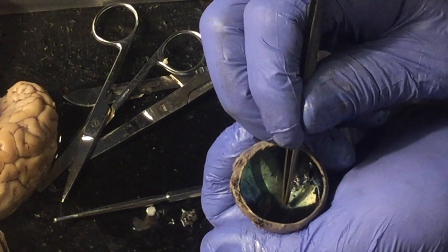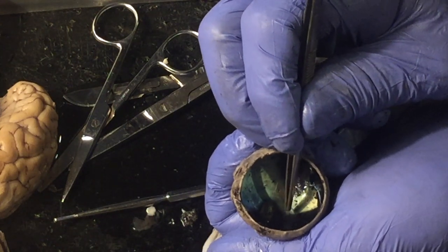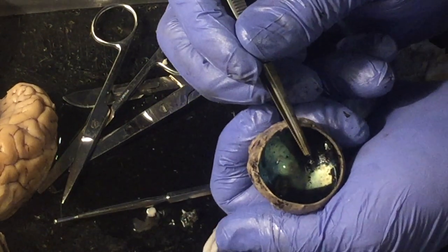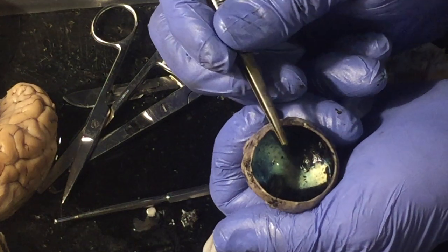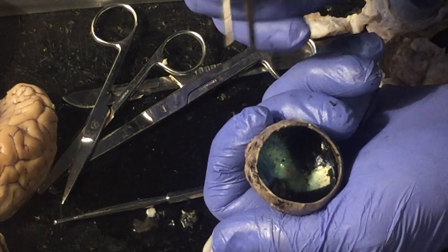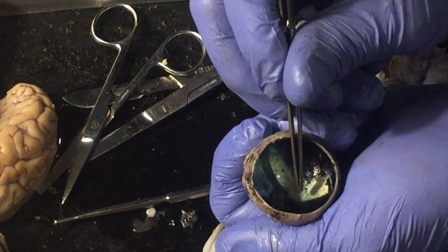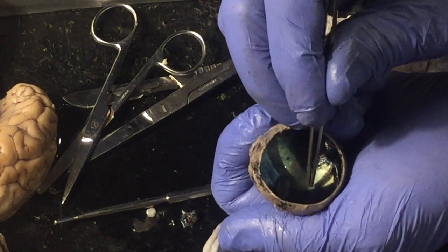It's actually in the center of something called the macula. And the fovea centralis is a spot where you have a particularly dense cluster of cones. And you have so many of them there that it allows you to see things really, really up close. And so that's what you're doing when you're holding something where you want to read it. You are focusing that image there.